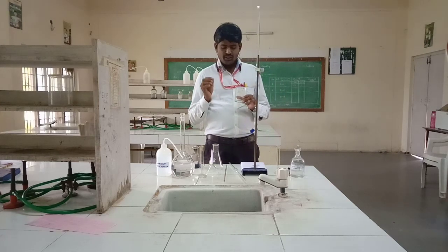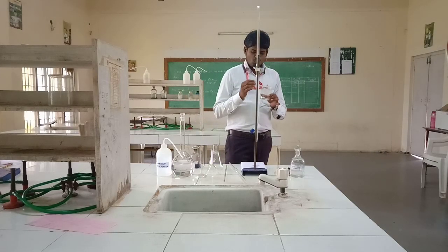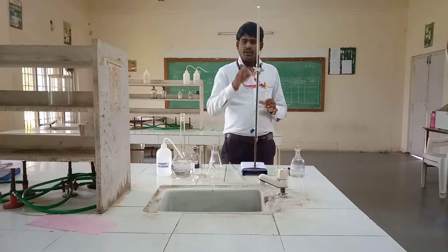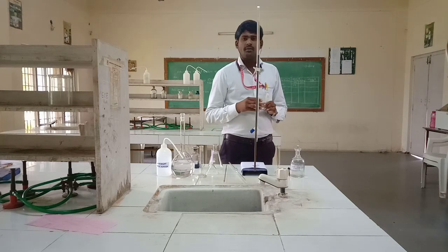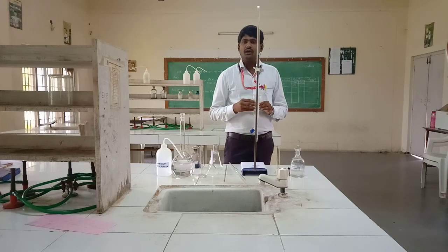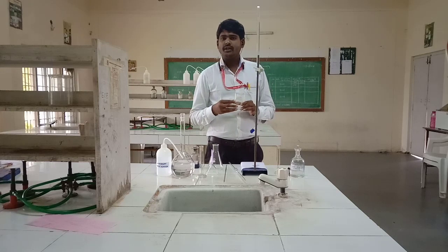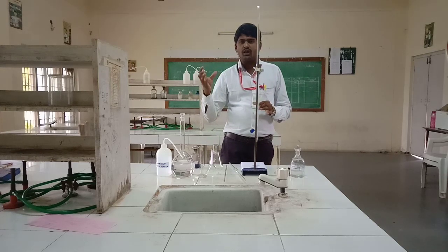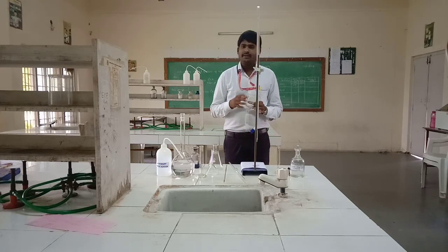In the presence of buffer solution at pH 9 to 10, this gives a calcium-magnesium-EBT unstable complex. This unstable complex shows a wine red color. Upon titration with EDTA at pH 9 to 10, this wine red color complex is then converted into a stable complex, and the color that appears is blue. Wine red color complex converted to blue color — that is the main point. This is the principle.